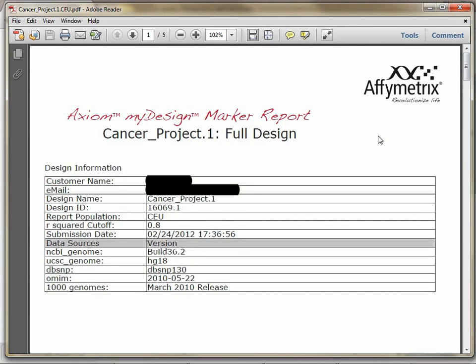So here we have the PDF report at the design level for the cancer project. At the top contains the summary information, including what the report population was and the threshold, and then what the version of the data sources that underlie the version of the database that you're using.